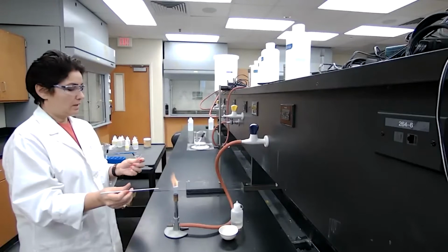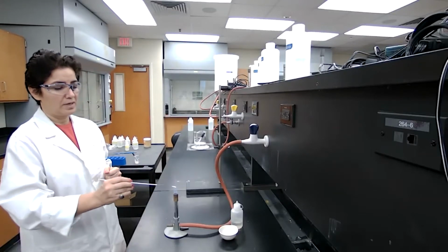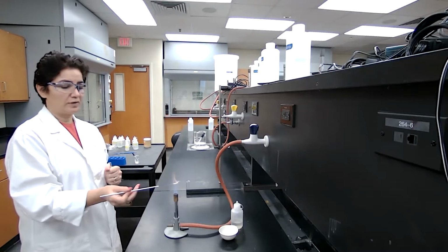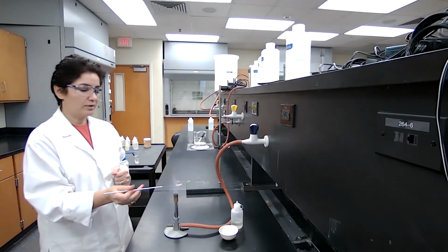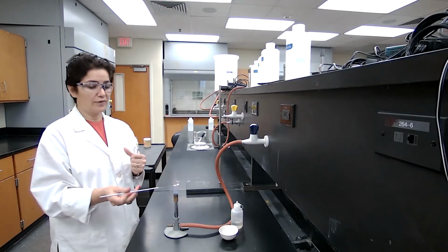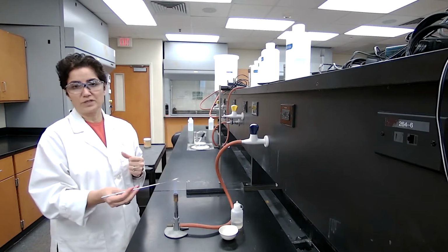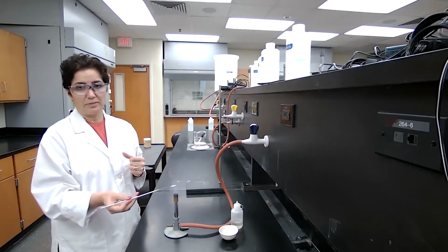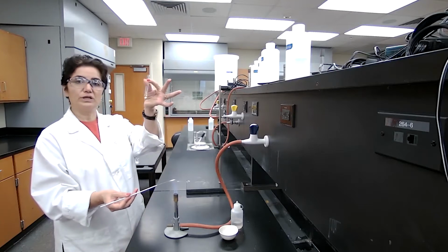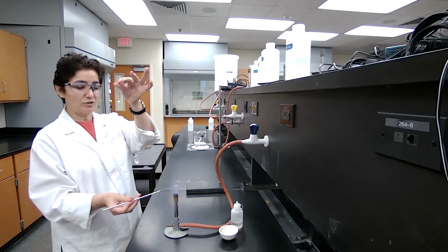For the unknown F, this is the second unknown. As I explained for the previous unknown, we are going to have only the soluble group plus the sulfide group here. To test for the soluble group, which is sodium, potassium, and ammonium ion, I'm using the original solution. I place about 10 drops of the solution in a test tube.